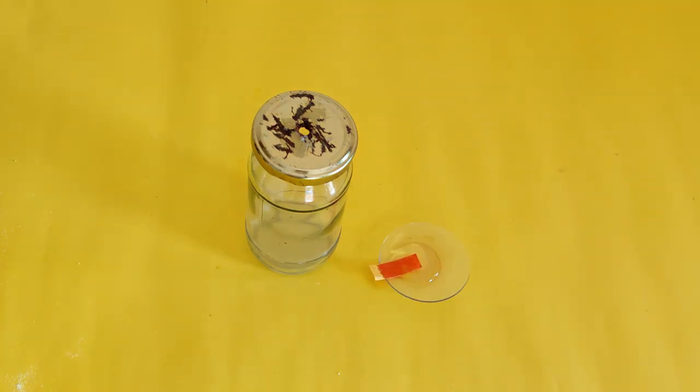You will notice it turns a pinkish orange indicating that it is acidic in nature.